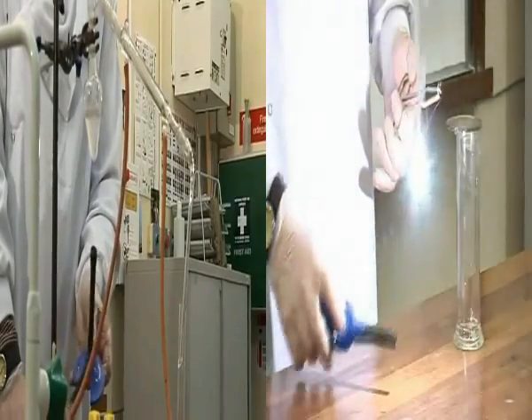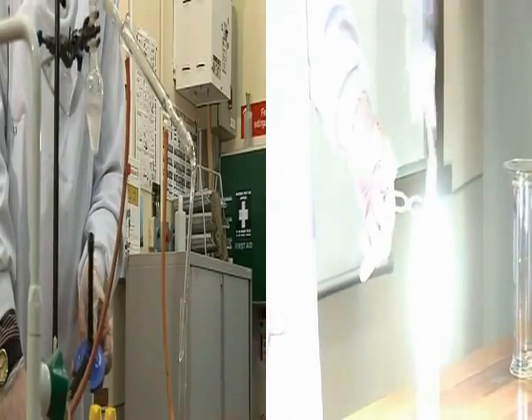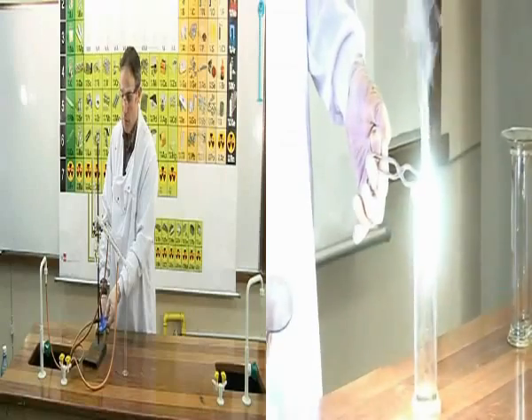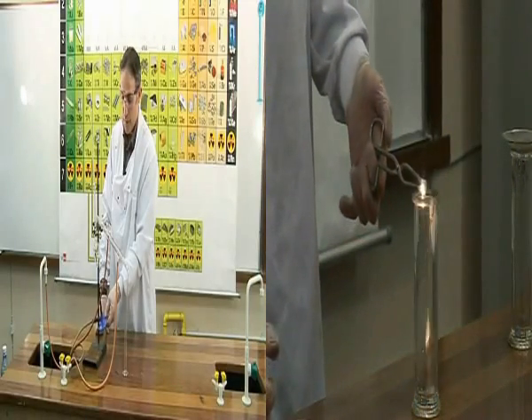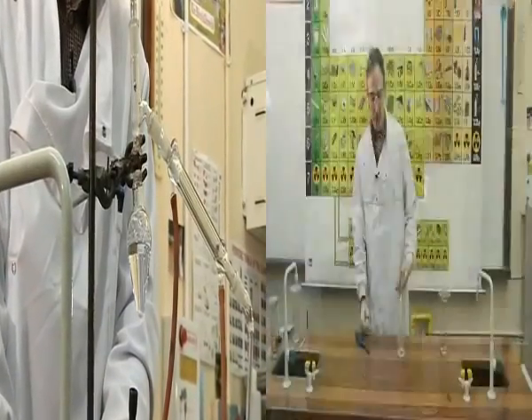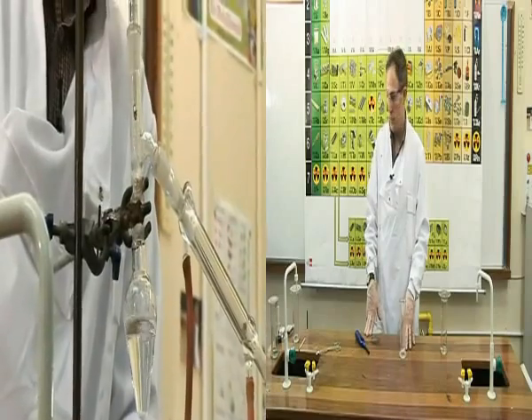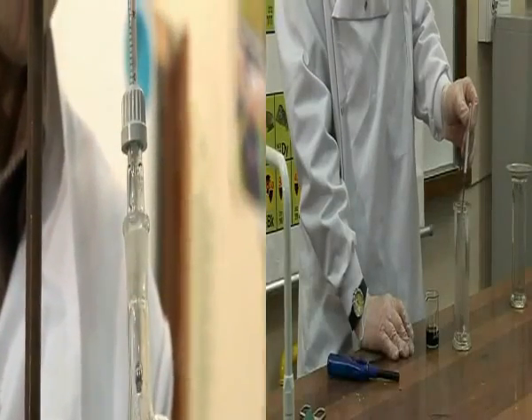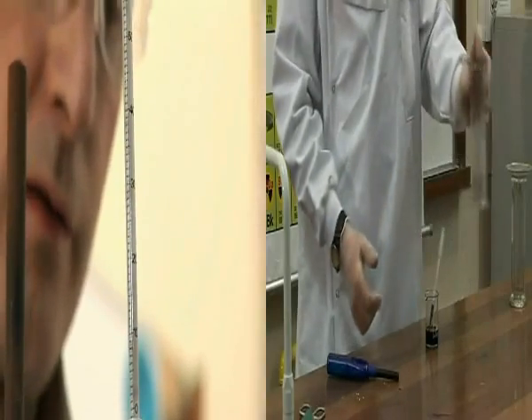It is important throughout the process to monitor the temperature of the thermometer, that it does not reach 100, as at that temperature both liquids will boil. We merely want it to reach 78 degrees. At that temperature, the alcohol will begin to vaporize. I have put in some anti-bumping granules to ensure that the solution boils smoothly. And as you can see, the alcohol is beginning to boil, so I'll remove the heat.